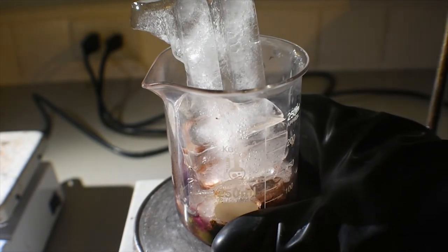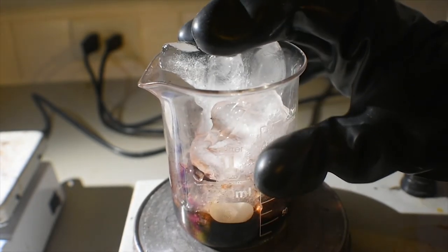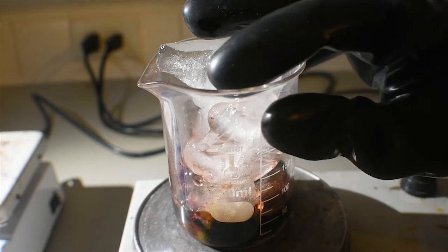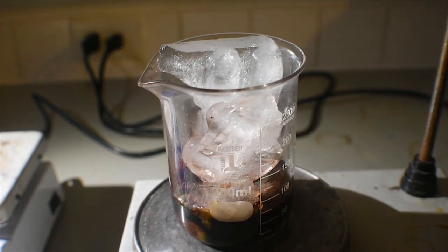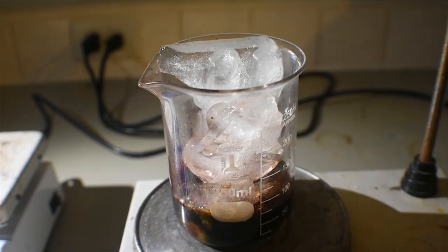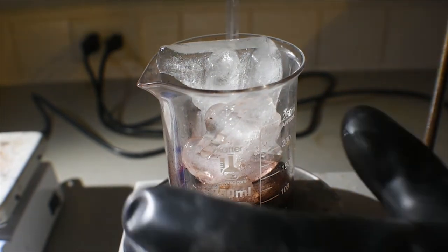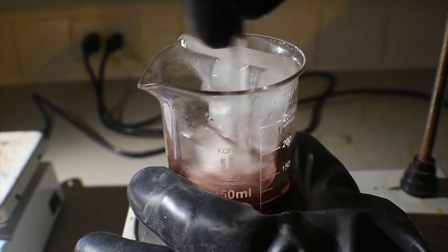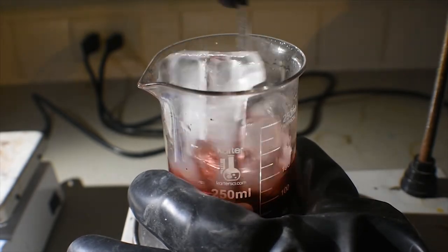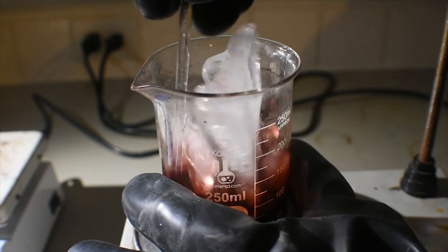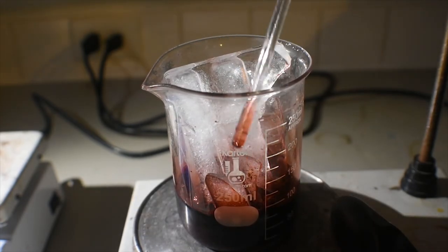Is it getting really hot? No. I'm gonna add some water. I should probably stir it around, that would make some sense. You can see the nice red color of the manganese-3 complex being formed.